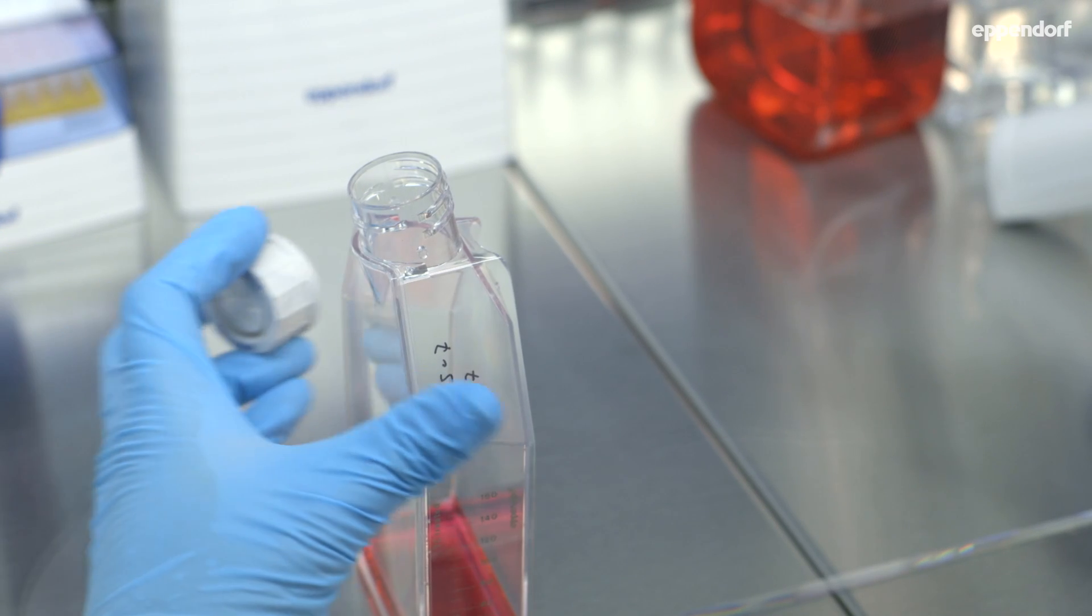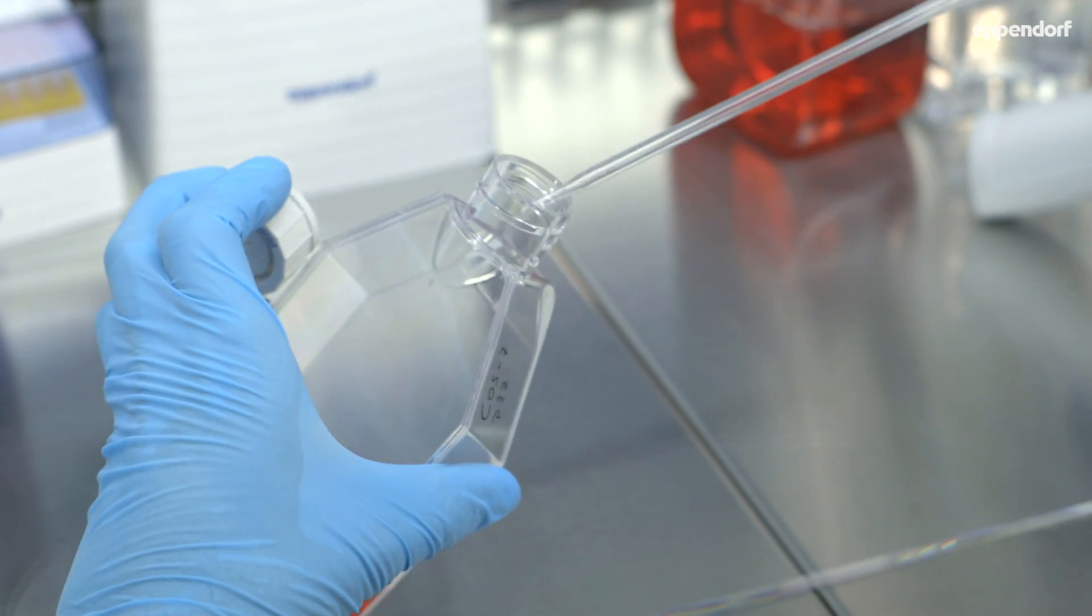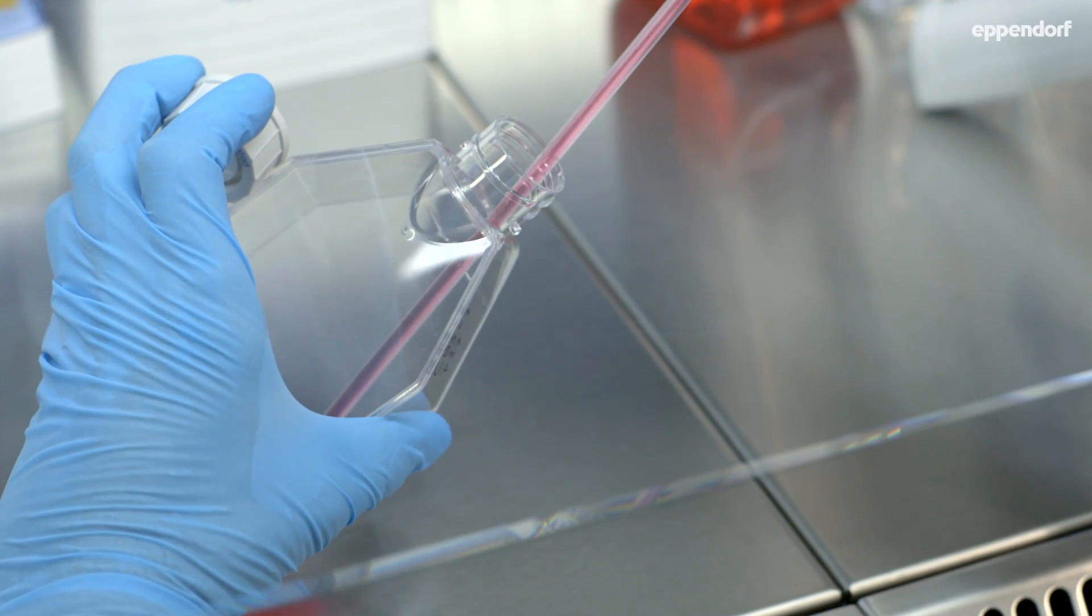When working with flasks, caps can be held in the hand during pipetting, but this requires practice and routine.